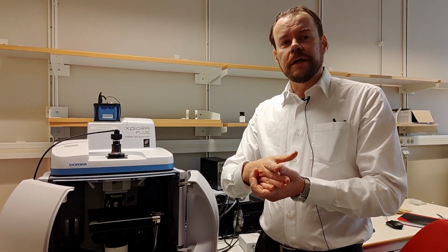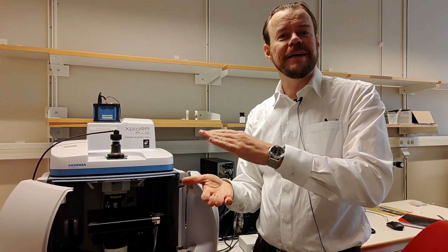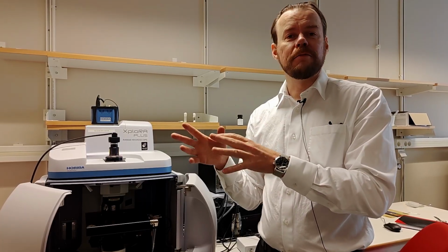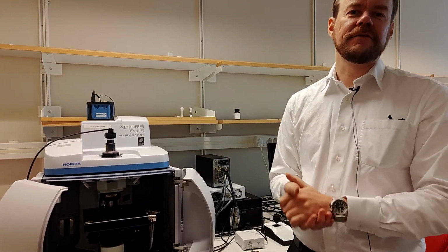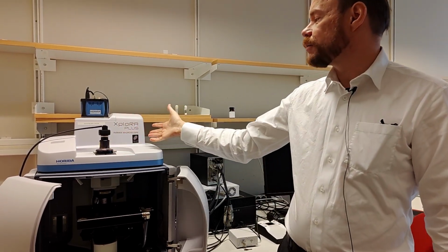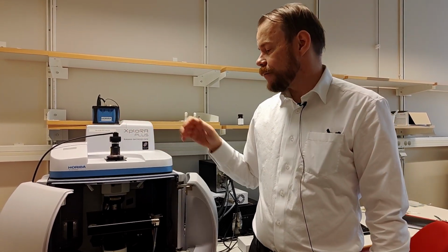So then you want to increase the wavelength. That basically means you decrease the energy of the photons, so you cannot accomplish that fluorescence phenomenon. That is the reason why you want to go up in wavelength. But this machine only has a green laser. This particular brand, Horiba xplora Plus, can be outfitted with 3 lasers, but we only have 1 at the moment.